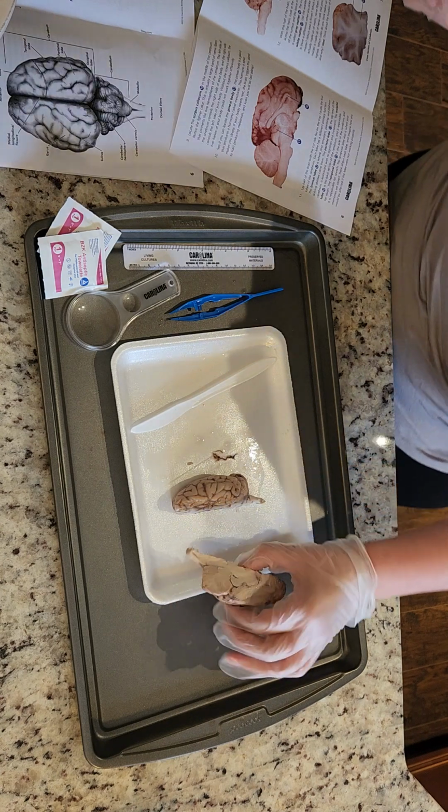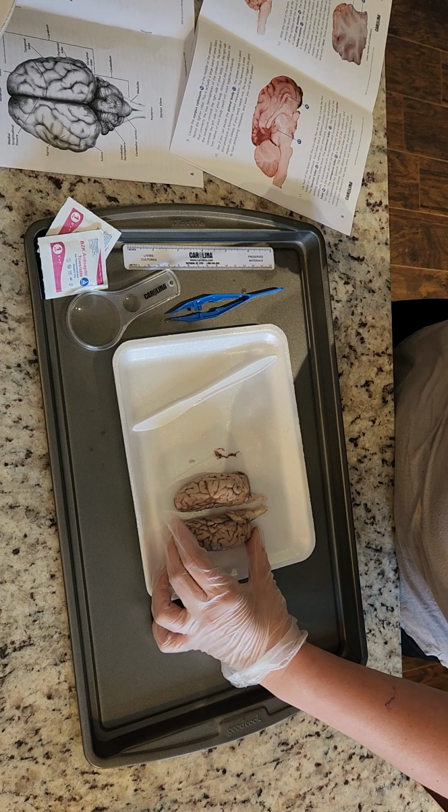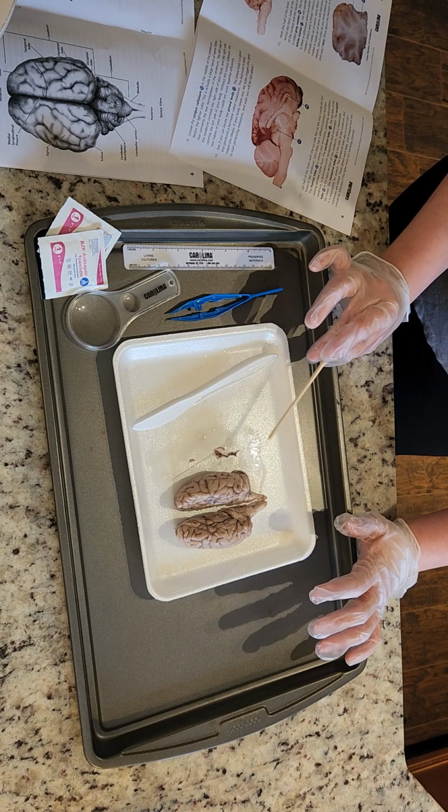So I'm going to lay this down and look over my instructions for a second.